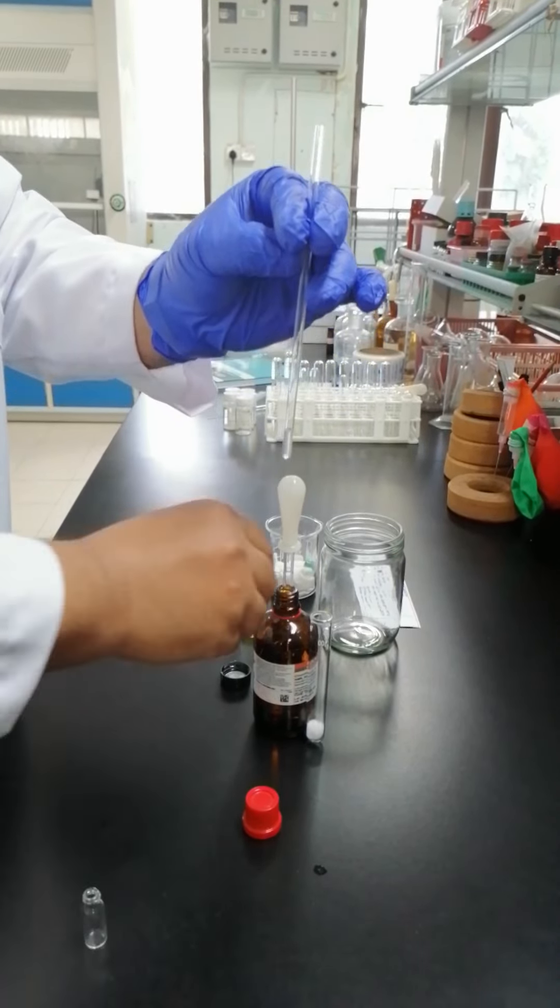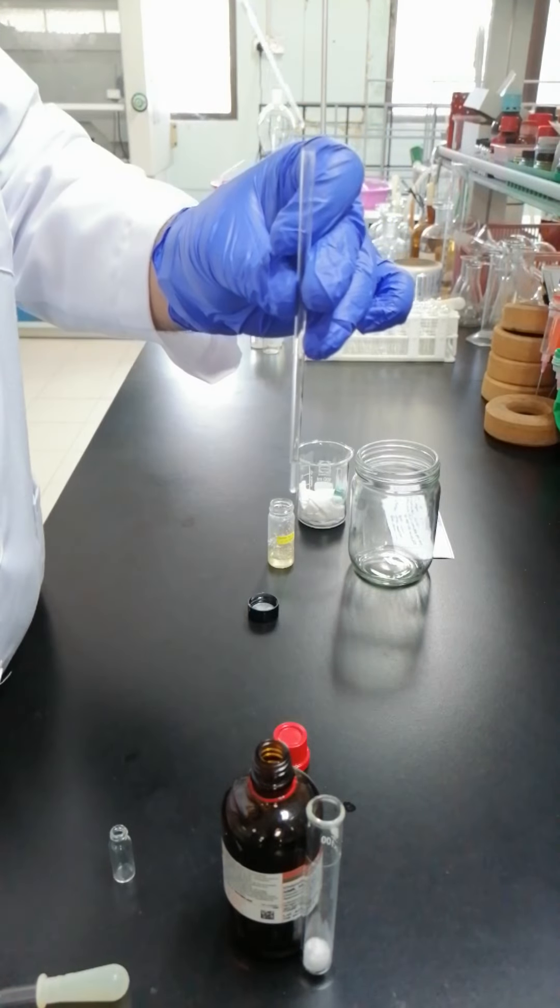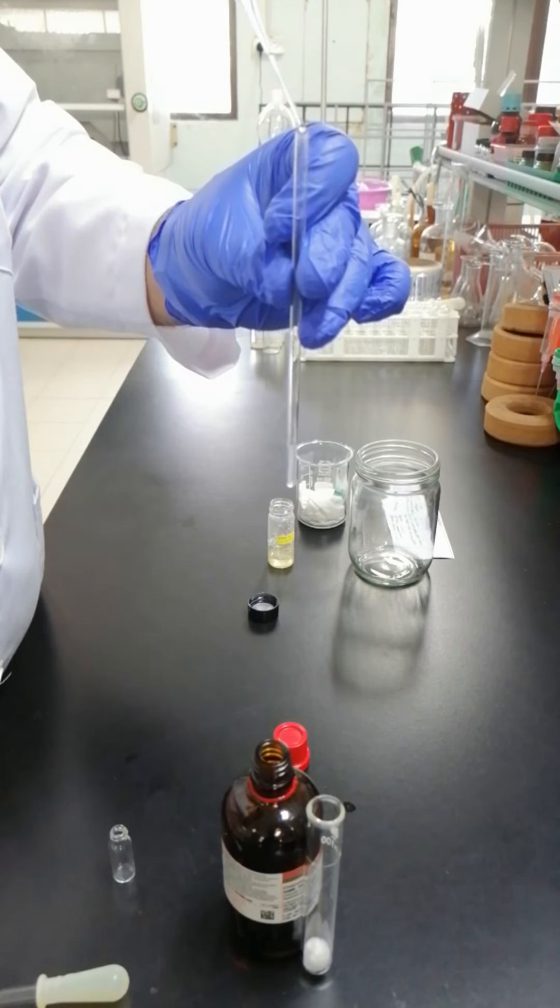And top part with the chloroform D until 4cm. This is 4 to 3.8cm. We have a bullet here. Until this becomes 4 to 3.8cm.